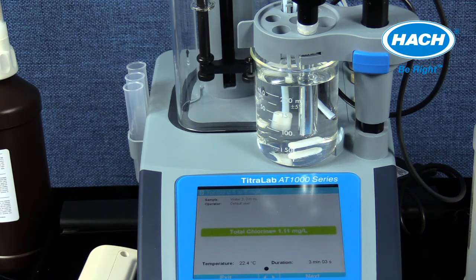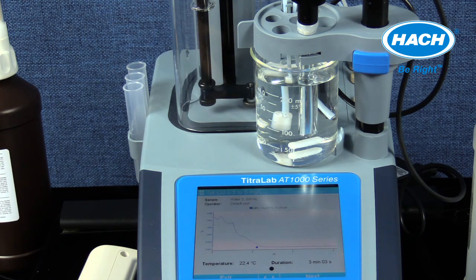The total chlorine concentration results are detailed in green, as well as the sample temperature and the time duration of the titration analysis. The black dot at the bottom of the screen indicates that there are subsequent screens of information. By using the arrow keys on the keypad, the second screen can be displayed. In this application, the second screen displays the final curve, highlighted endpoint, titrant volume, and current measured when the endpoint was achieved. If measuring more samples, then the next button can be selected. If there are no other samples to be measured at this time or using this application, then exit can be selected.